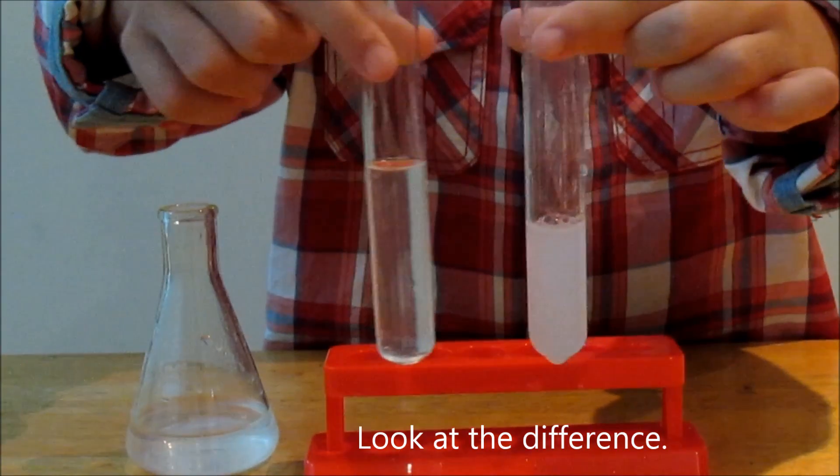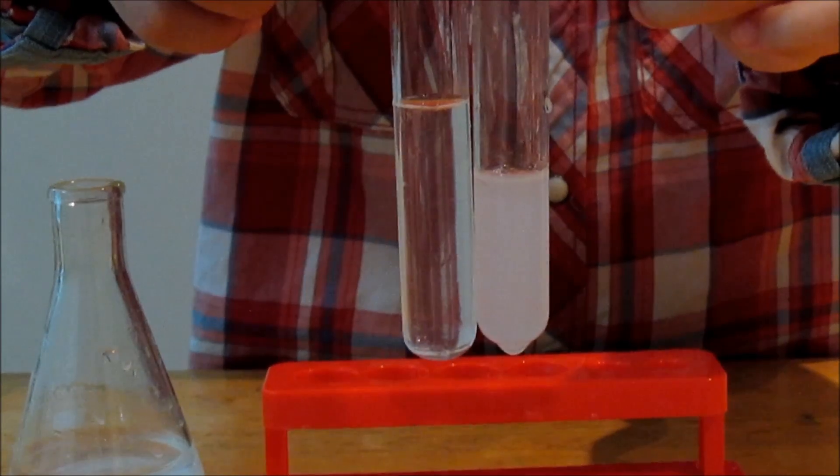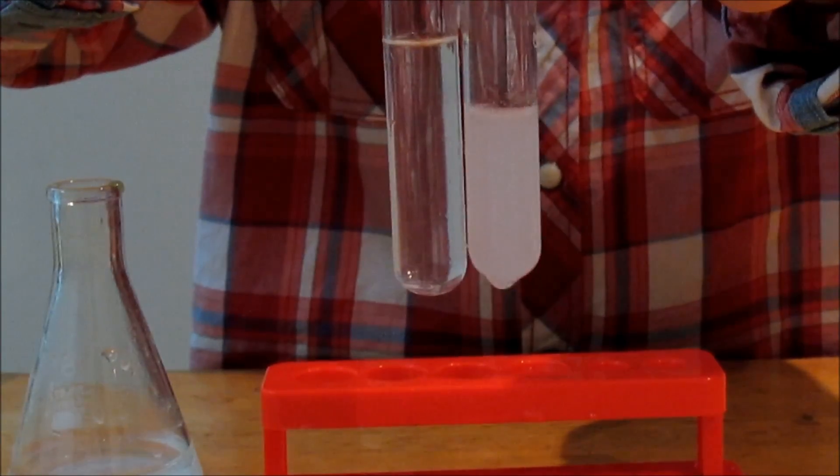Look at the difference. The lime water turns cloudy. This signifies that carbon dioxide is present in your breath.